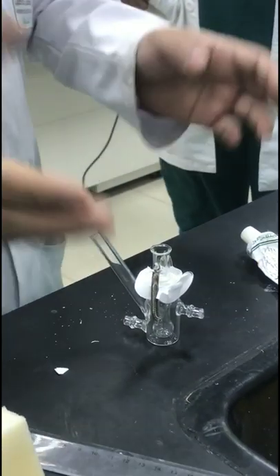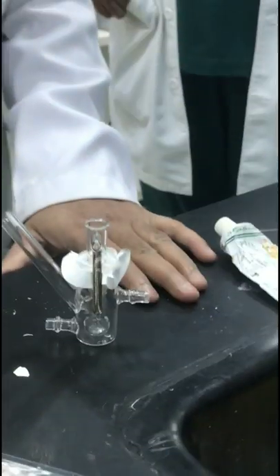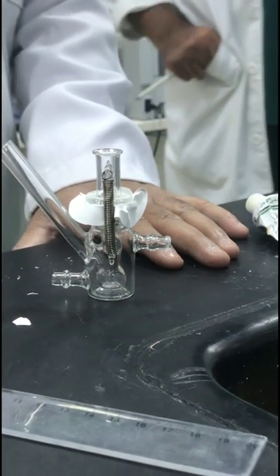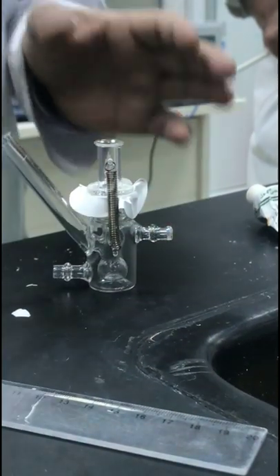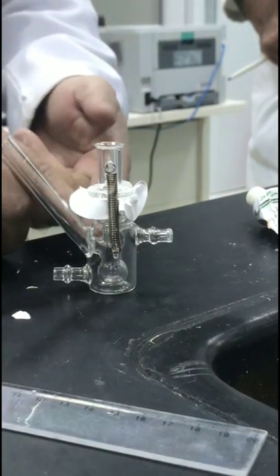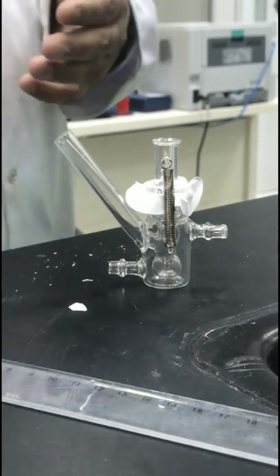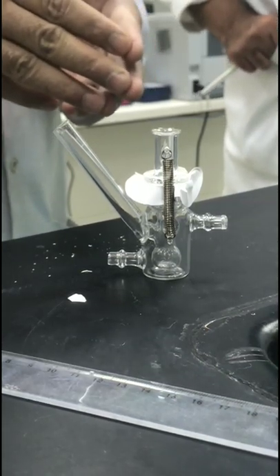Usually this experiment runs for four to eight hours, but it can be extended up to 24 or even 48 hours. With less time, you can do frequent sampling. Take samples at 10 minutes, 20 minutes, half hour, and so on, measuring the concentration to find out the amount of drug crossing the membrane at each time point.